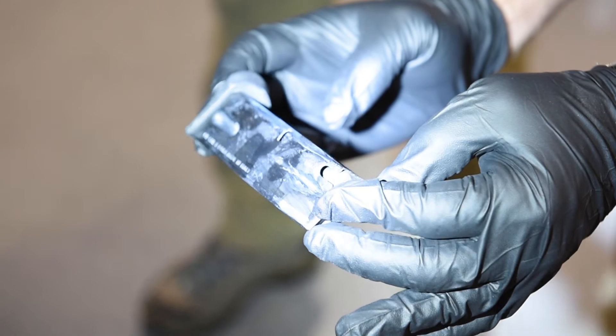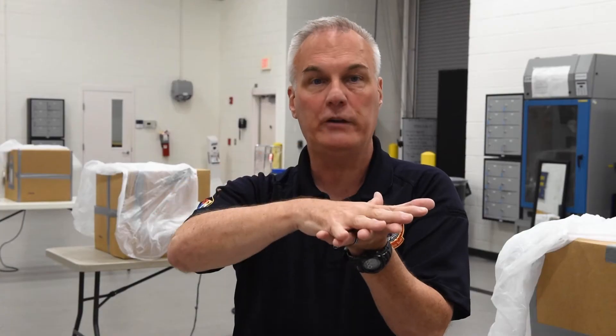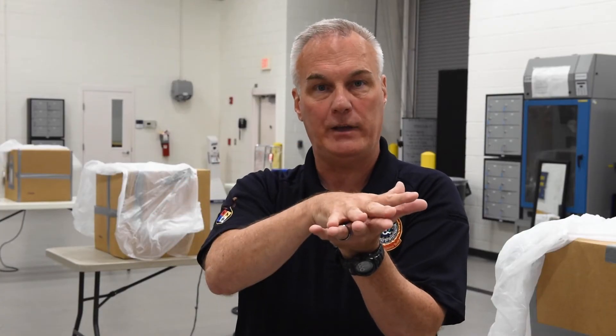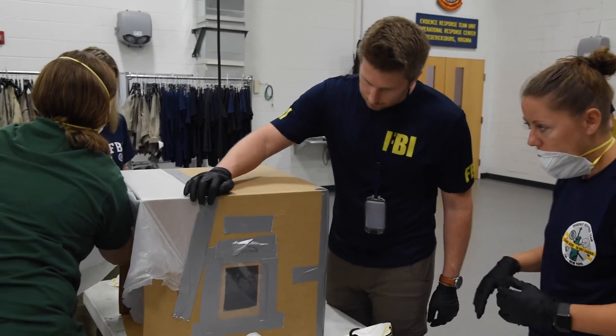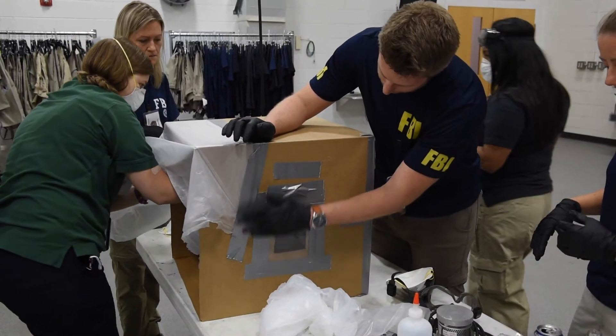The superglue adheres to it. If you put too much on there, it fills in the gaps, and now you've got a nice smooth surface, and you've just gotten rid of the ridge detail that you want, the contrast surface.